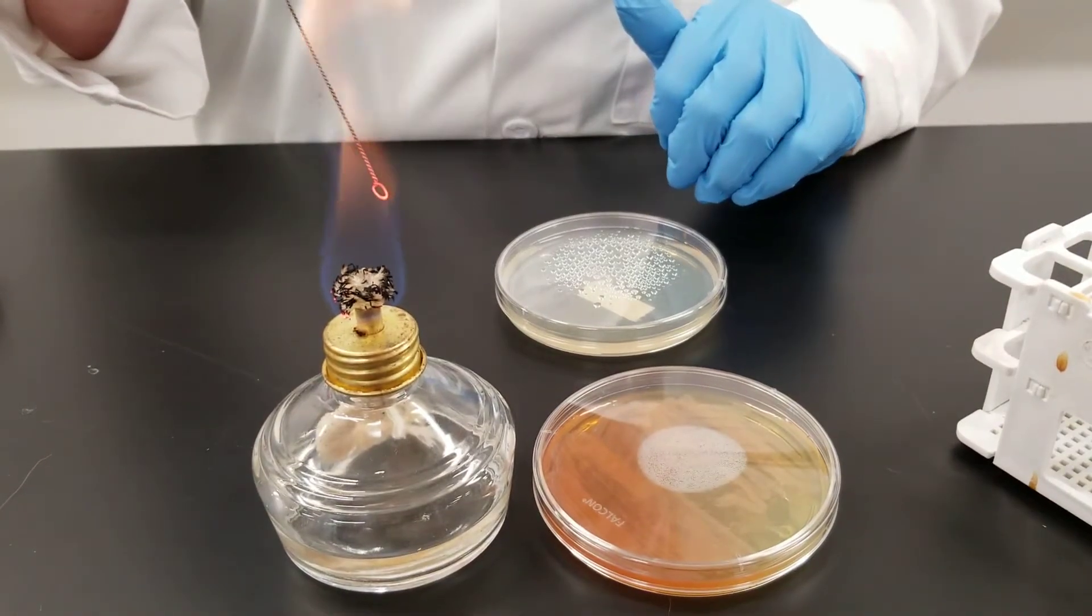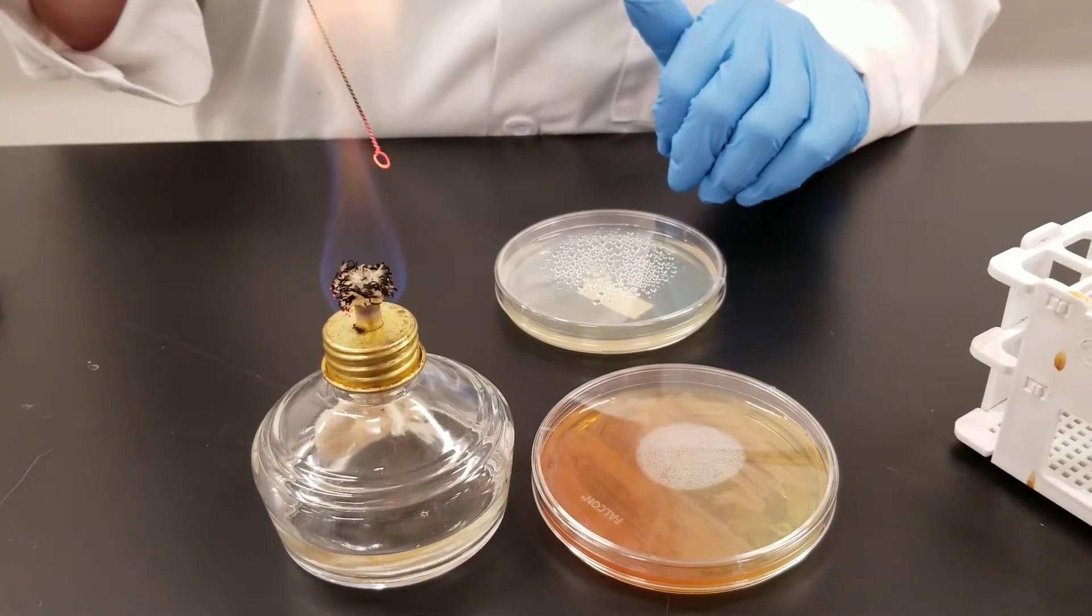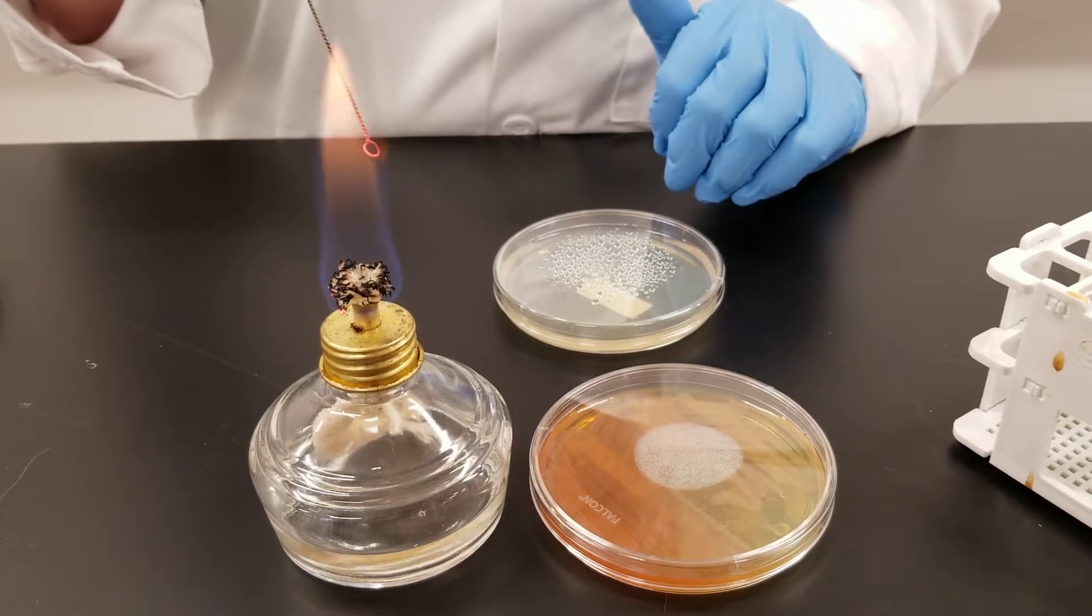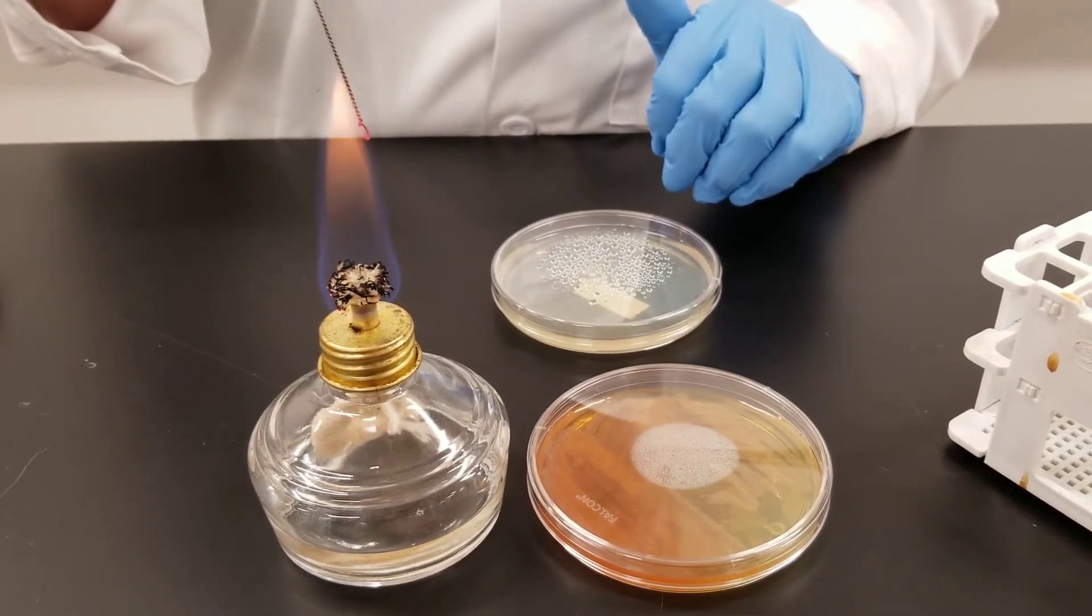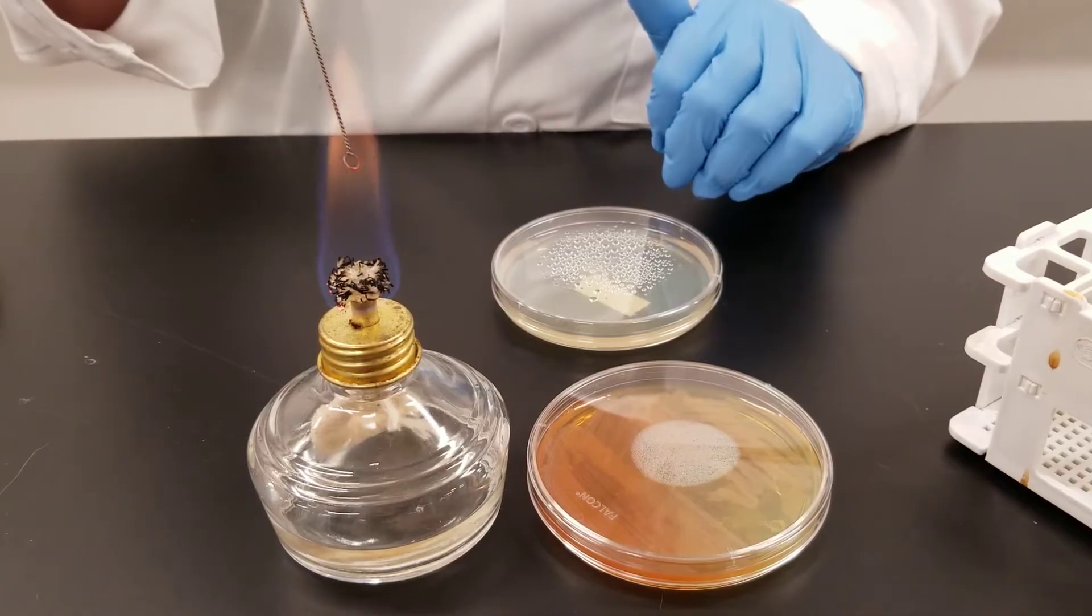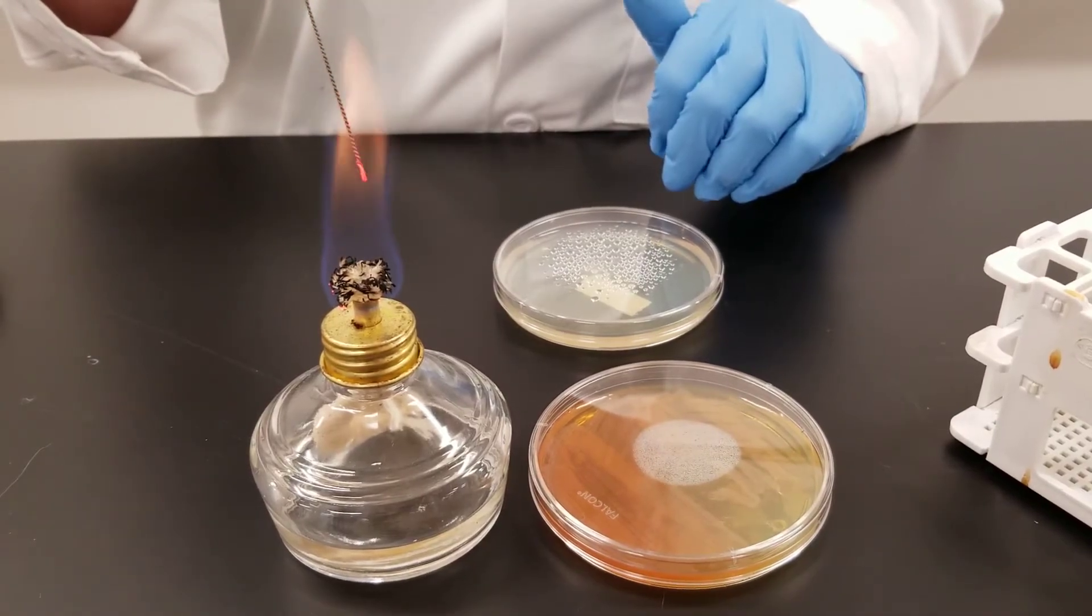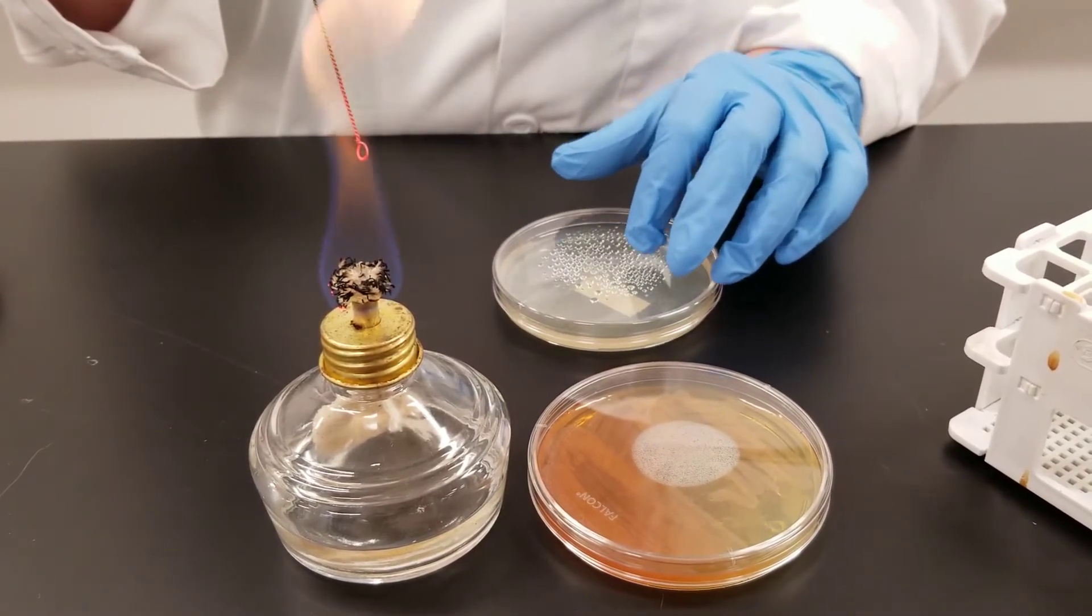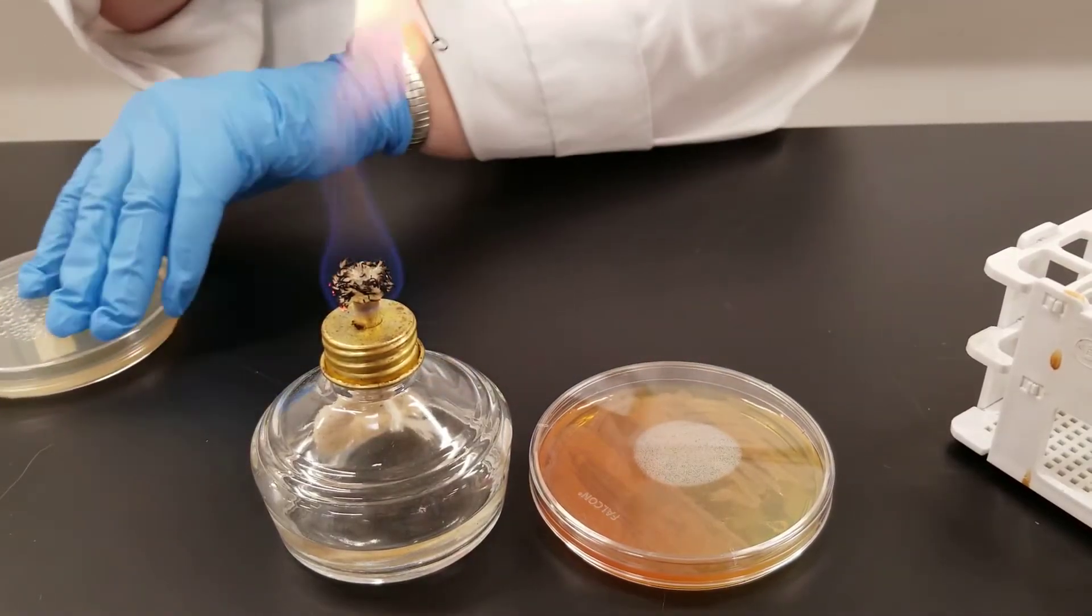Each individual colony, the idea is that it arose from a single individual bacteria and is a pure colony. So if you have a mixed culture, this is an easy way of trying to isolate out and get your pure culture. So both of these plates have now been inoculated.